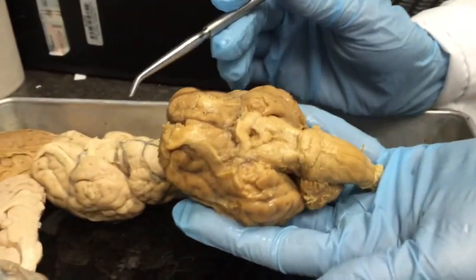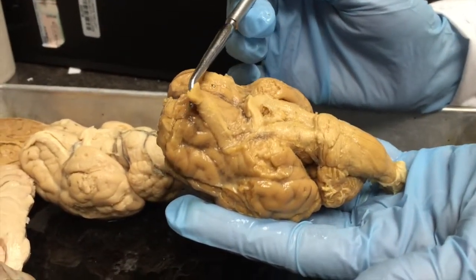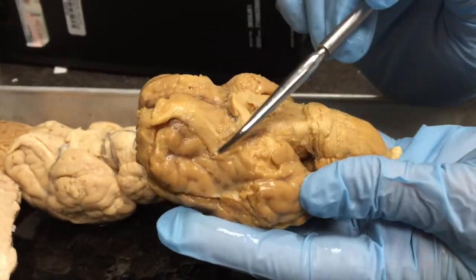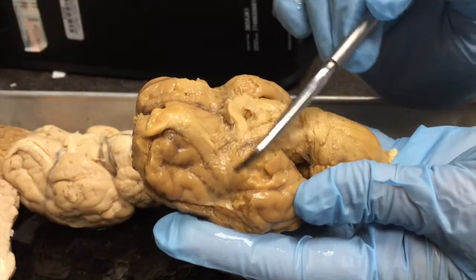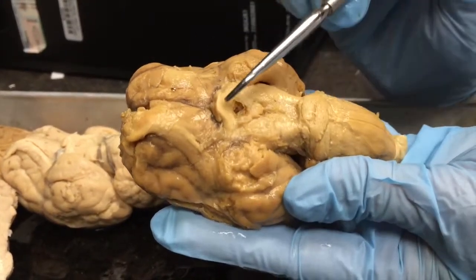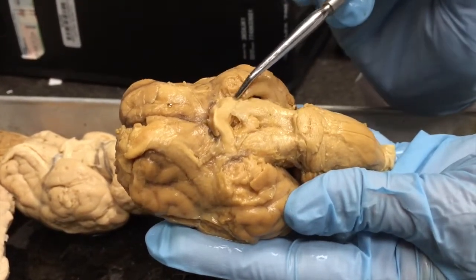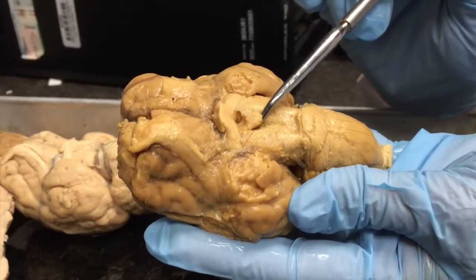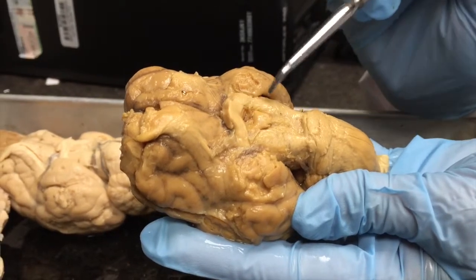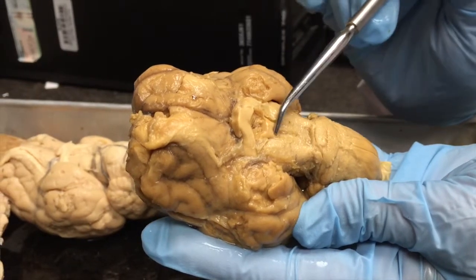If you look at an inferior view of the whole brain that doesn't have a Dura Mater, you can see the olfactory bulbs are very large in the sheep brain. Coming back at an angle here would be the olfactory tract. Here is where the optic nerves were cut, and the optic chiasm is right there. These would be the optic tracts. This is the mammillary body, and unlike in the human, where you have two rounded structures making up the mammillary bodies, the mammillary body in the sheep looks like a single structure.